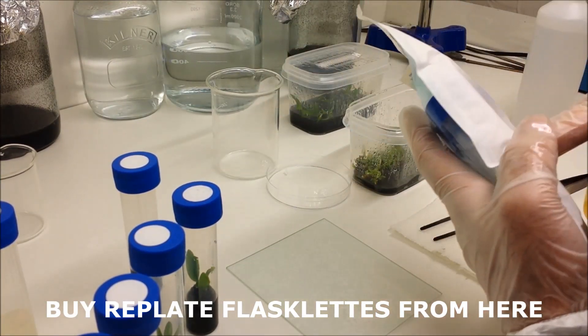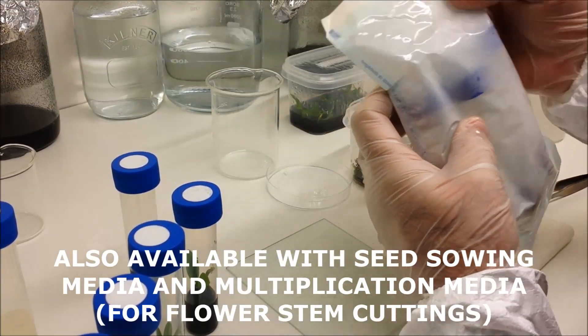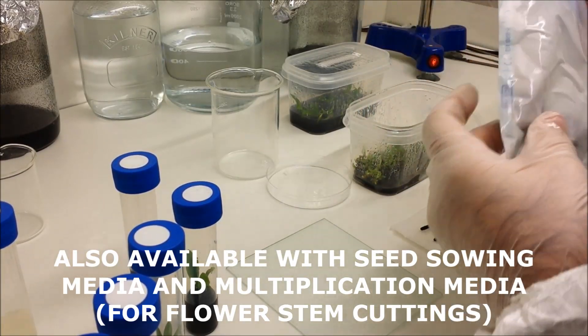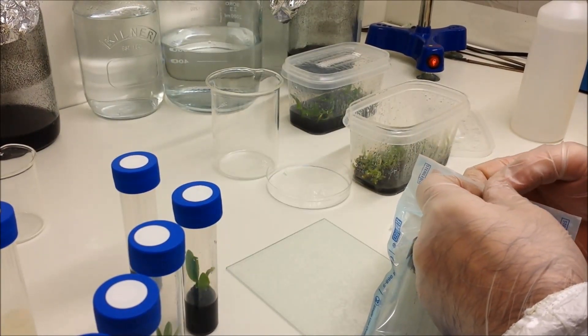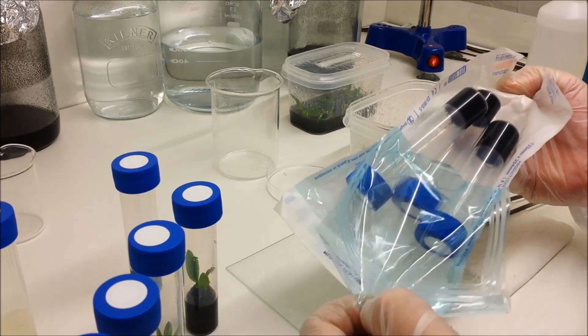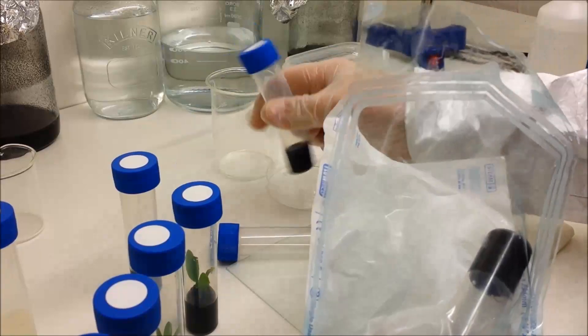Now these flasklets have already been sterilized once, but I'm doing it again just to remind you of how important it is to sterilize the outsides of everything. And again, as we've said earlier, inside the packets is already sterile—the medium is sterile and the environment is sterile. So remove your flasklets.